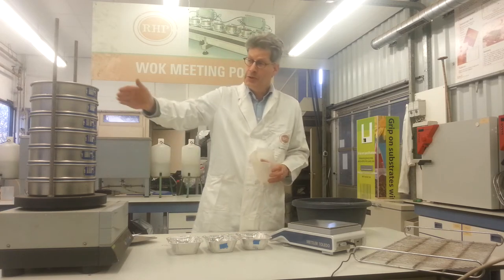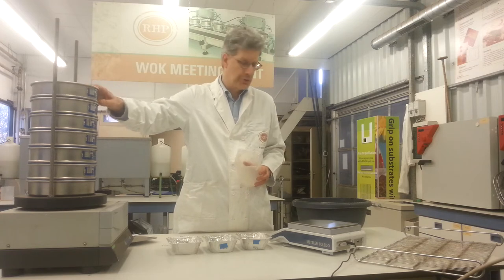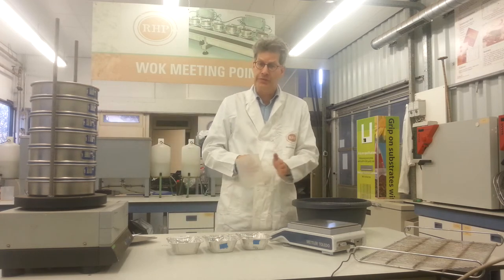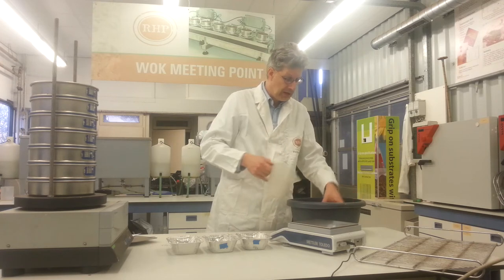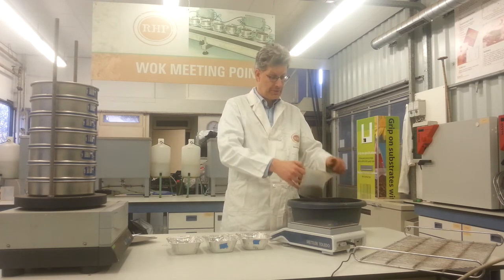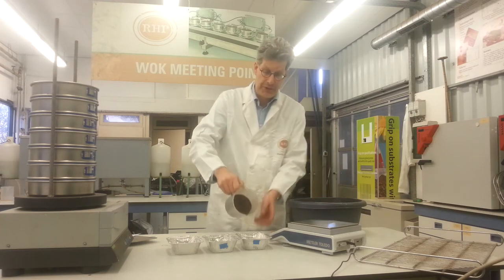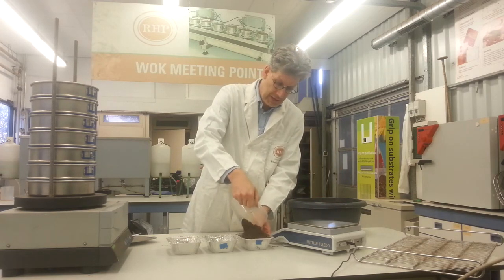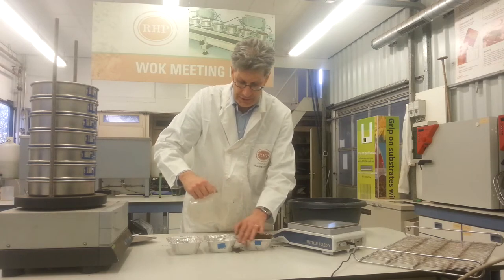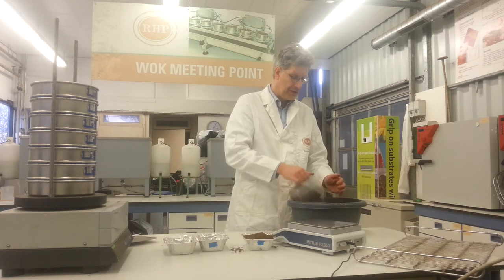Because I have a small screen set — 200mm, not that big — I only have to use 400ml per subsample, and I can do it with a simple measure from this homogeneous sample. I take approximately 400ml and put it in the trough. These trays are very convenient because they are just big enough for 500ml, which makes it quite easy.